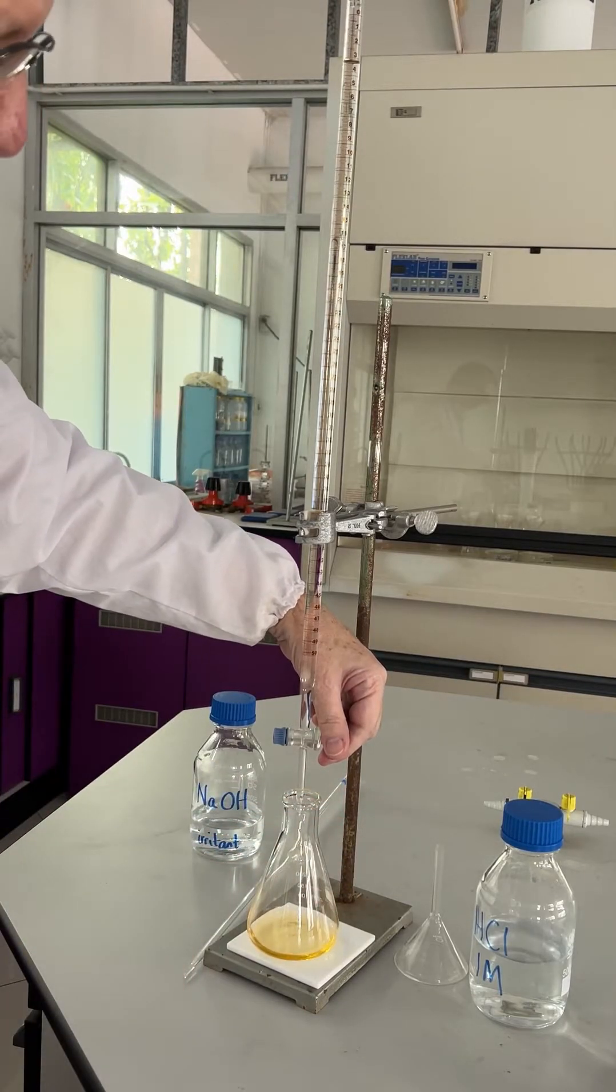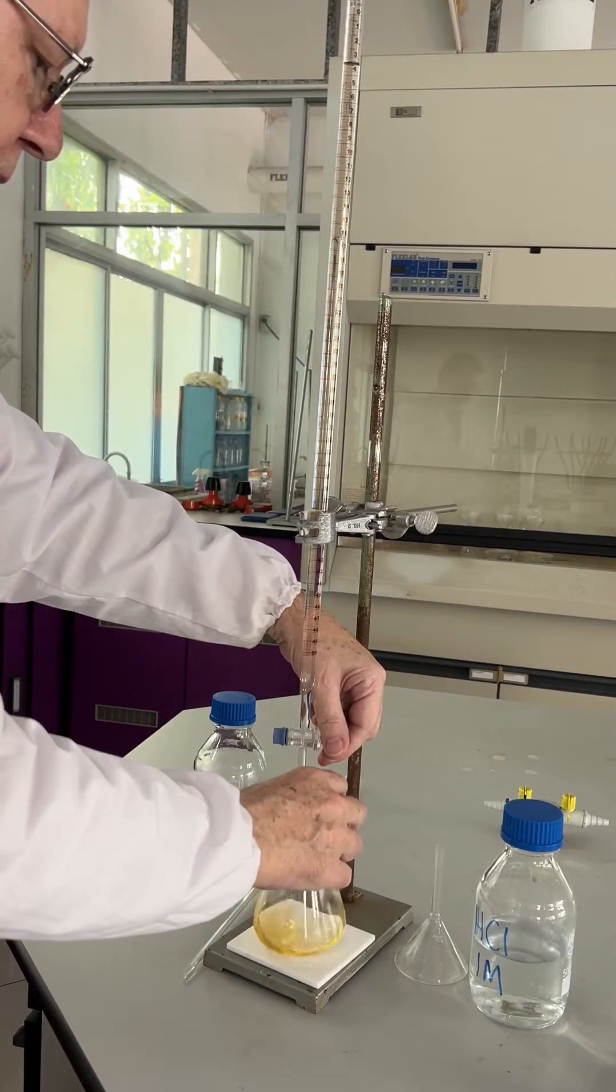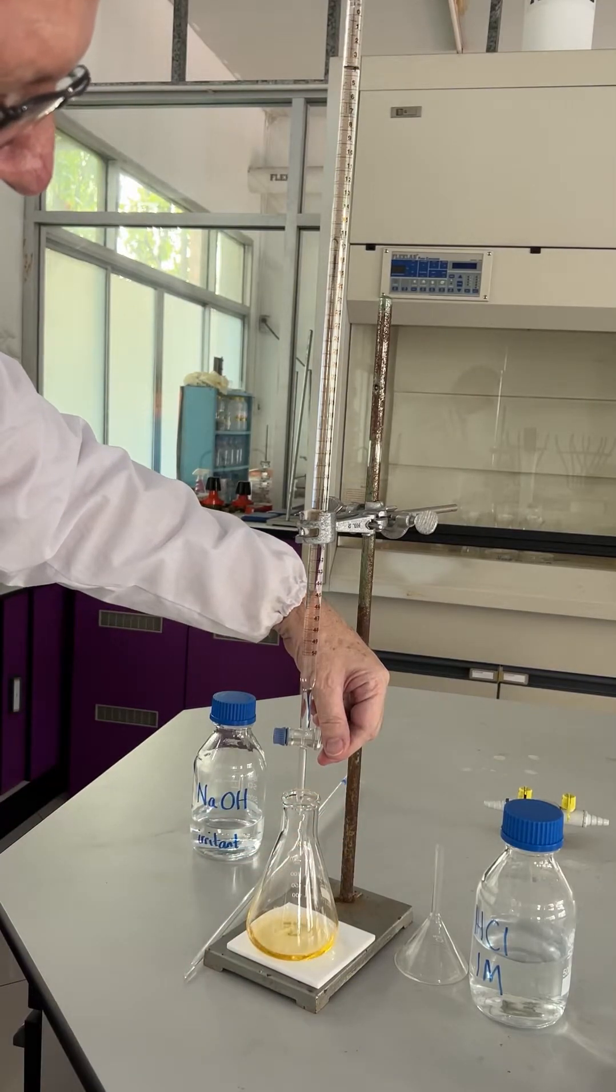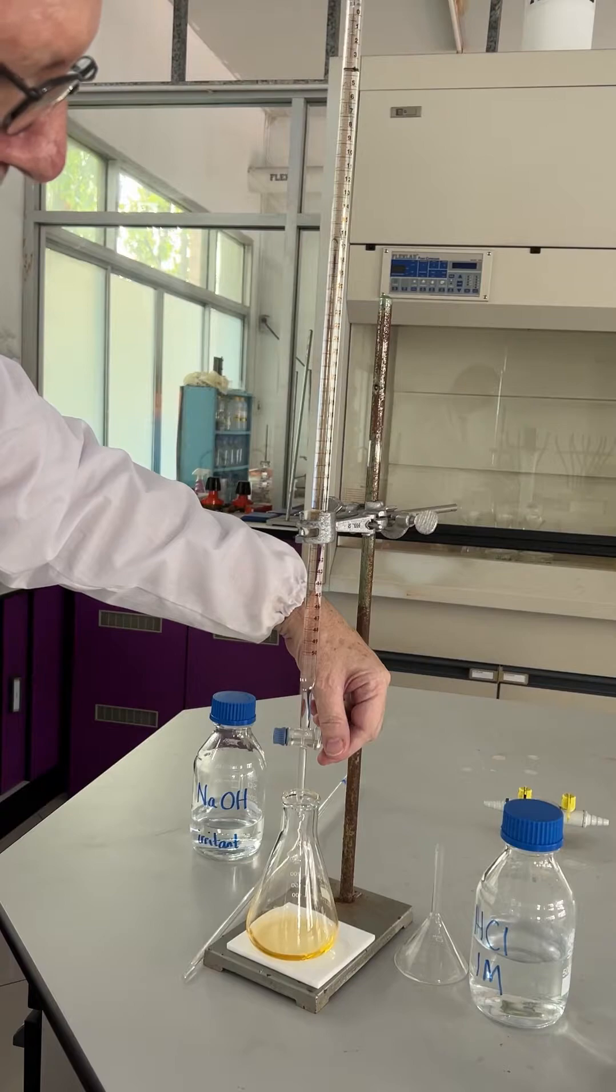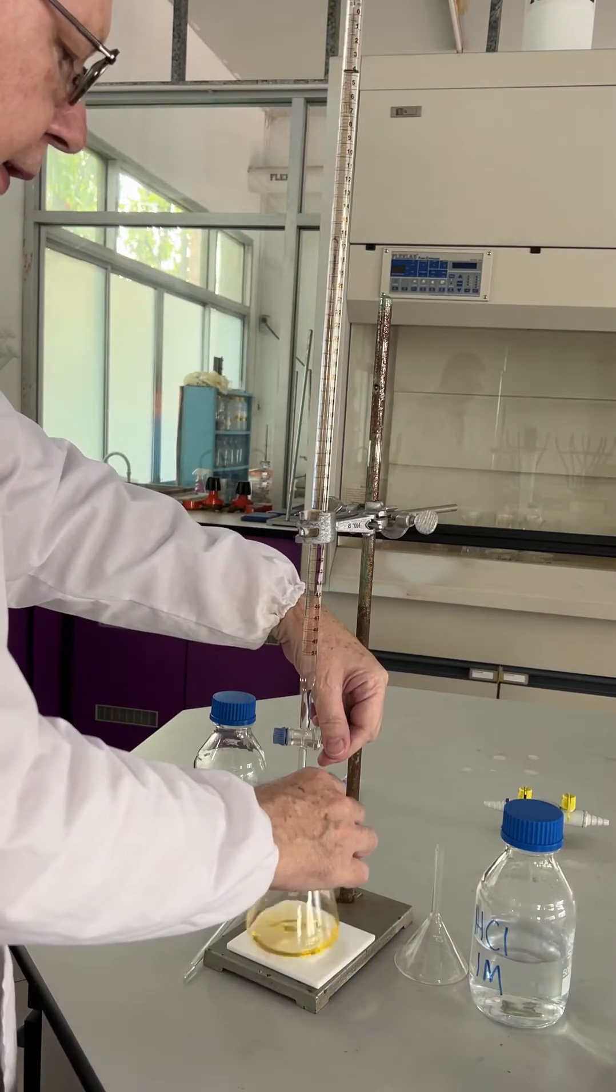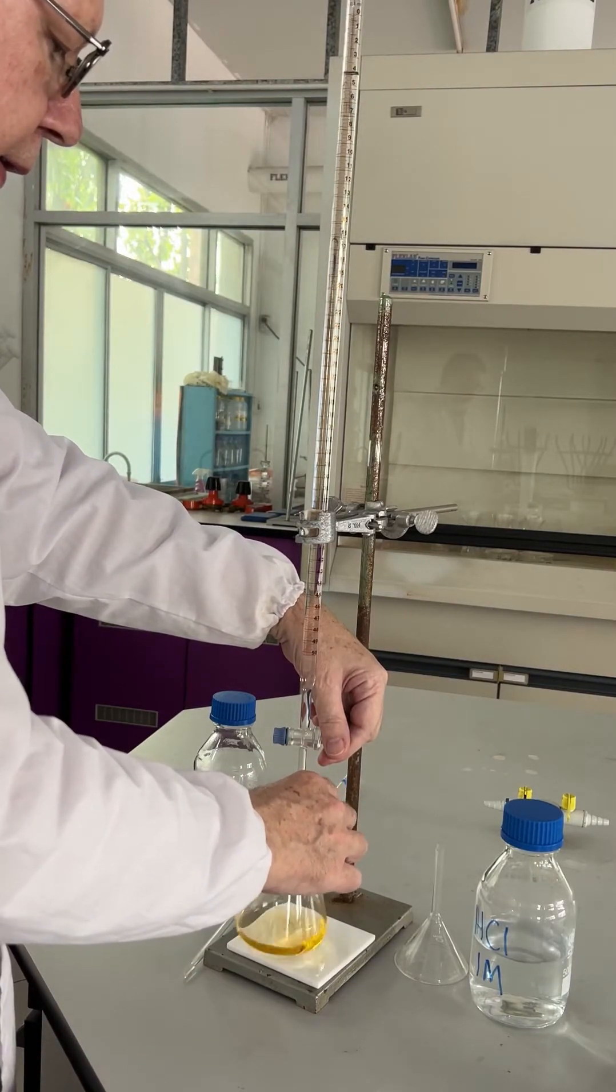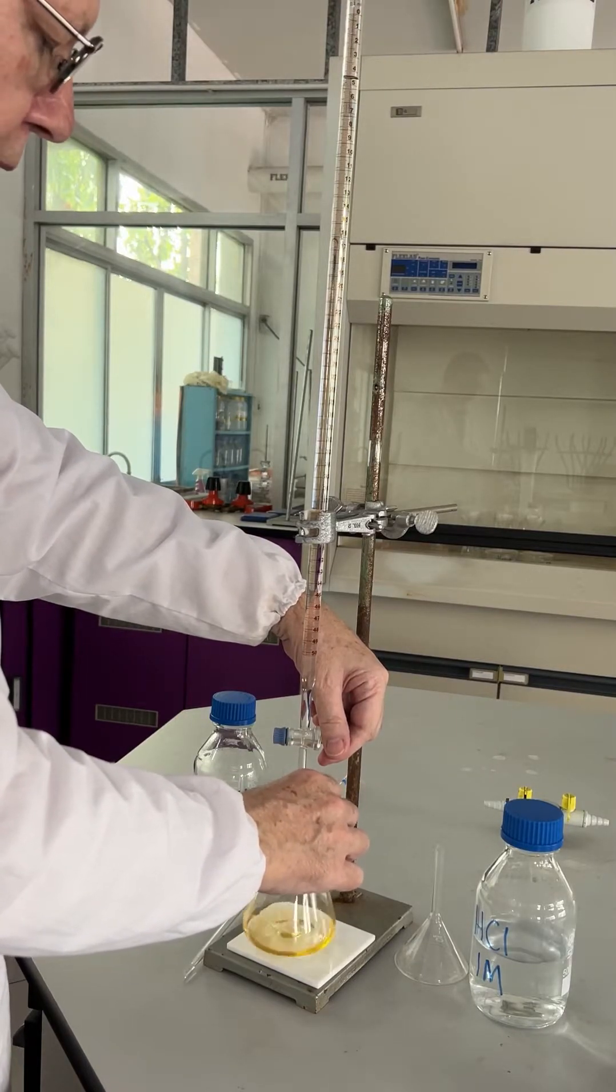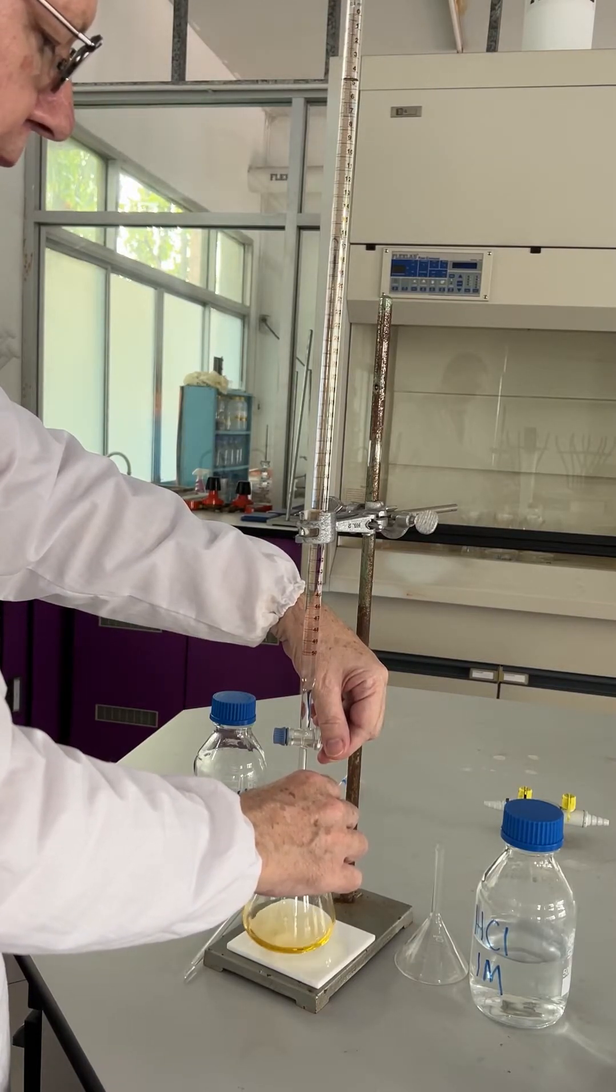You may be able to detect a slight pink coloration around the drops as they fall into the alkali. So let's speed up a little.